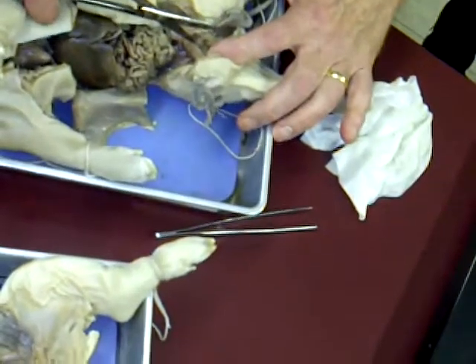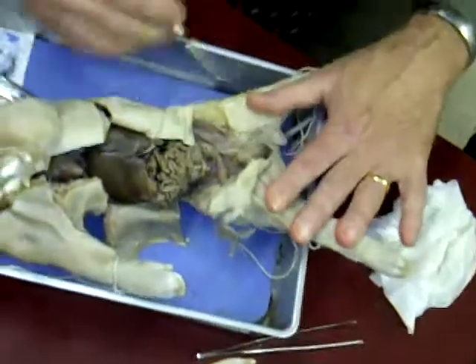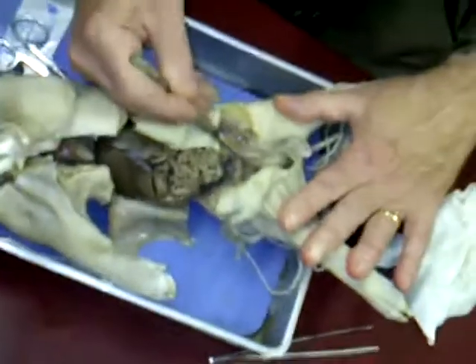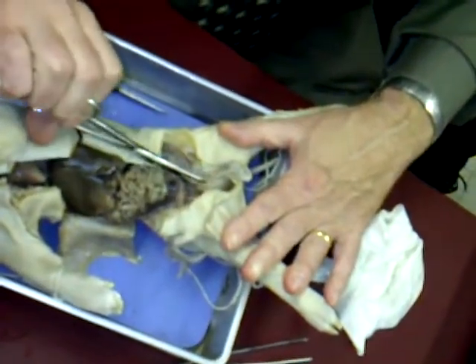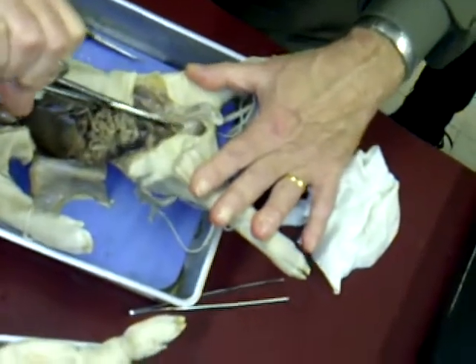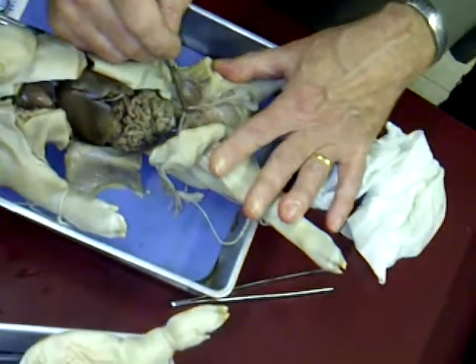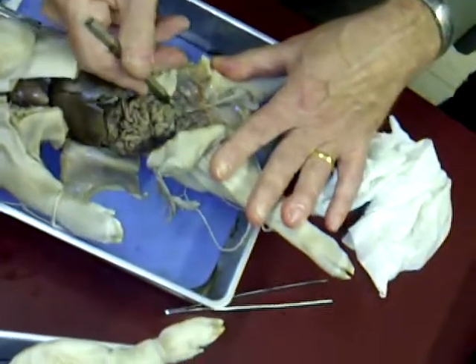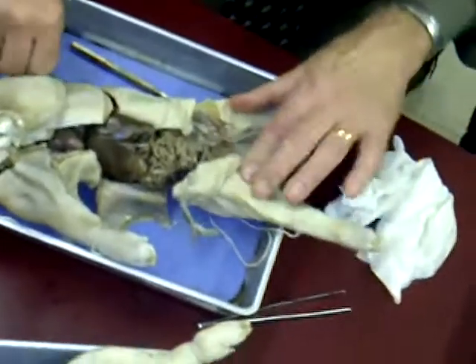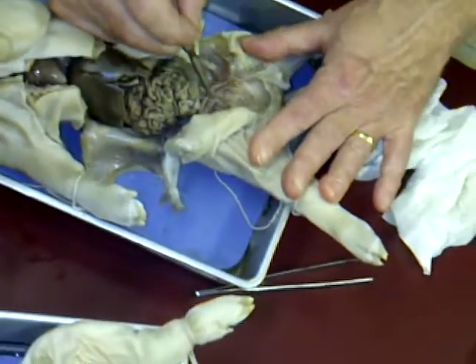but then, and this is the part I always screw up because I always end up cutting it, but I don't want to cut it because it's very difficult to do. You see how, maybe I don't even have to cut it to really show you what's going on, because you can see where it comes down. It goes through behind the pubic bone here. Oh, I guess I will cut it. It descends down. See, I still didn't get all of it. It's behind the pubic bone right there. There it is. Tell that distinct snipping sound. You can see it kind of disappearing there.